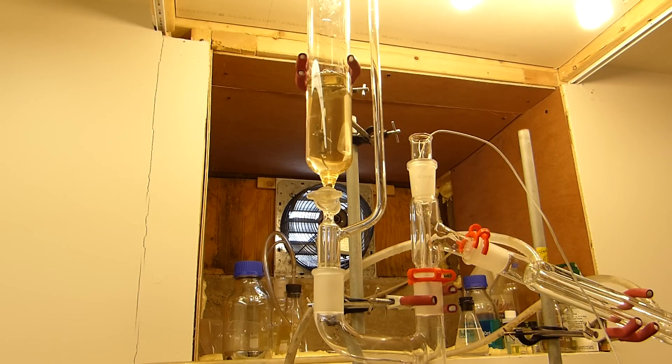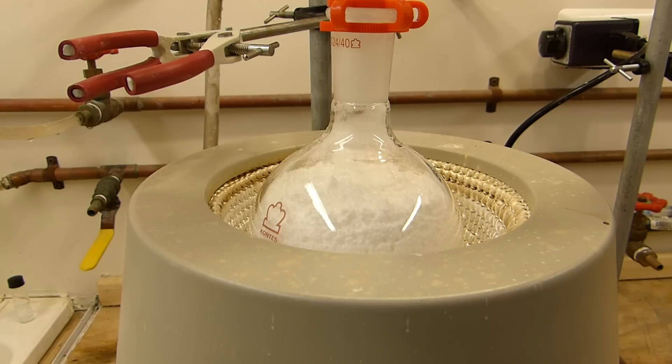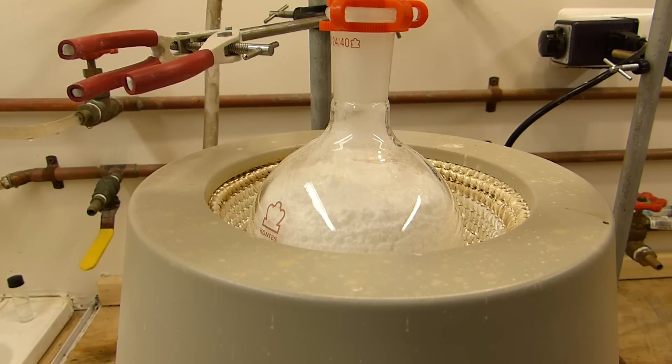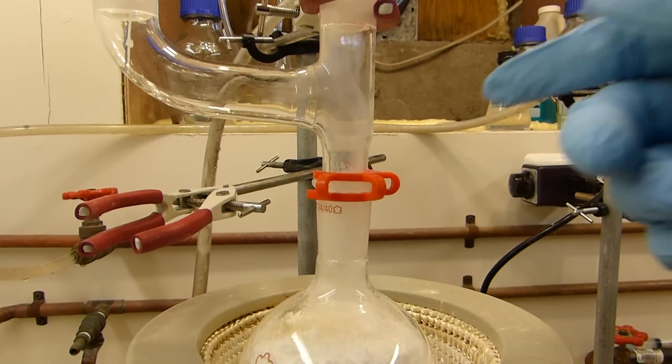We'll now slowly start adding the sulfuric acid to the anhydrous sodium acetate. And you can see the effect that the acid has on the sodium acetate, immediately generating an exothermic reaction and causing a lot of packing. You can see there are some vapors rising.